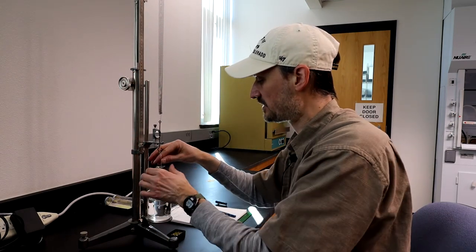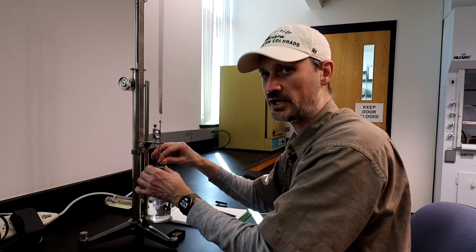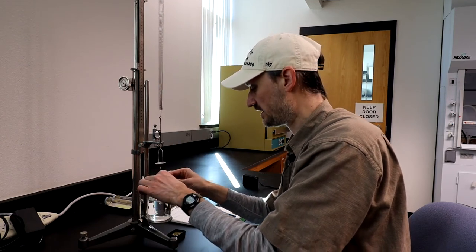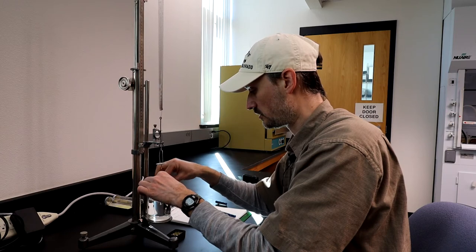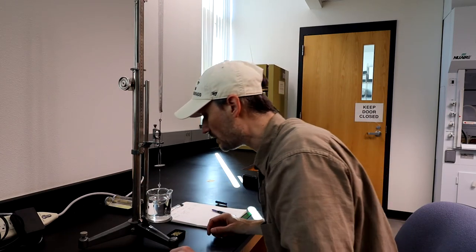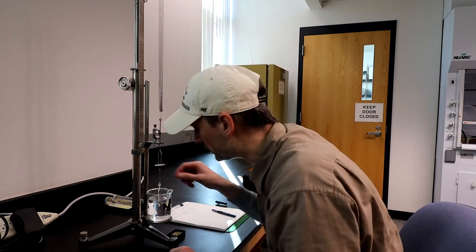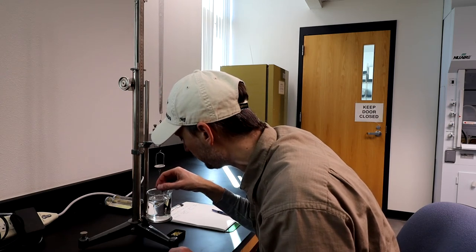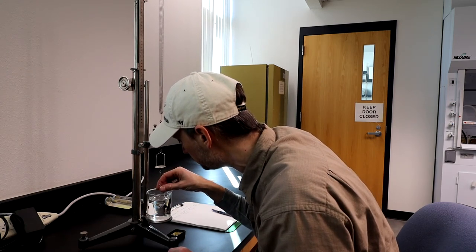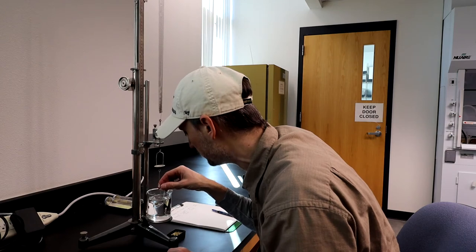We then move the specimen from the upper cup and place it into the lower cup, and then take a look to make sure there aren't any air bubbles stuck to the sample in the lower cup.